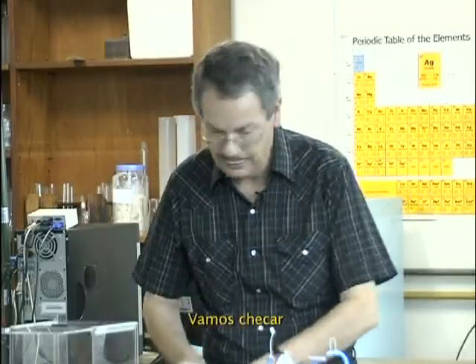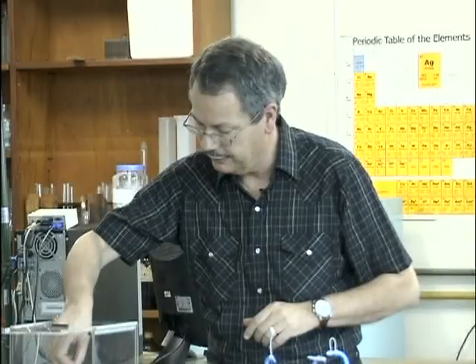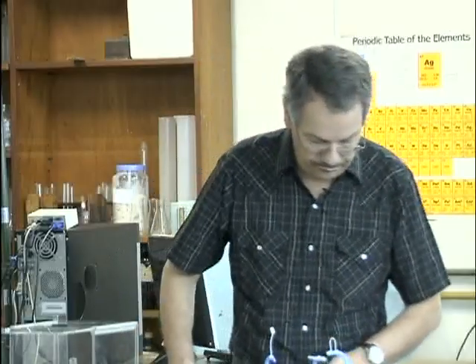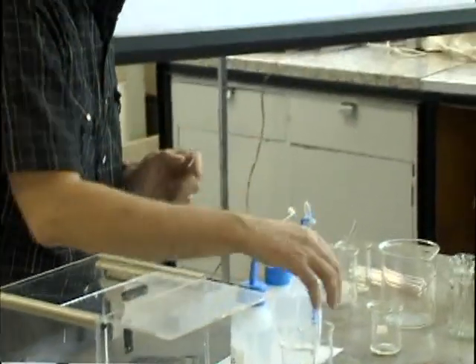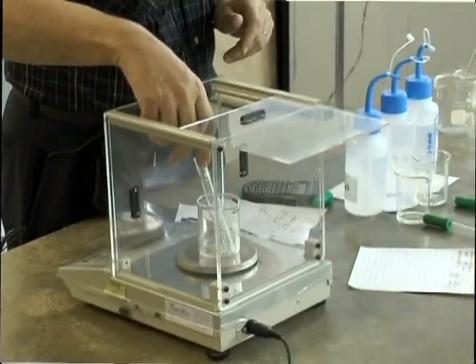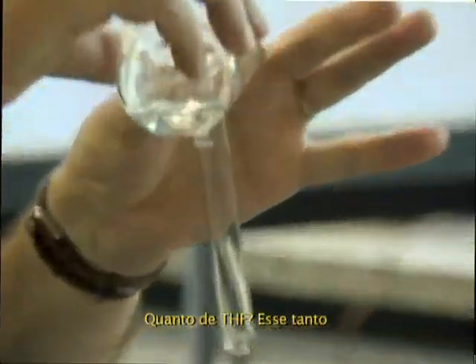So let's check. Third tube, this one. Zero again. So we say 80% THF. I can use that one. Is this zero? Yes. How much THF do you put? This much.